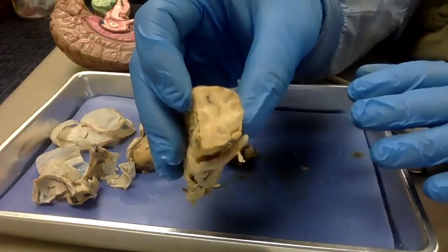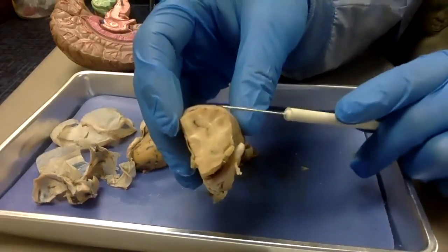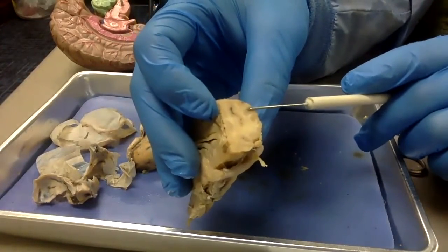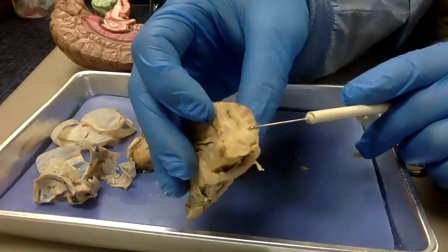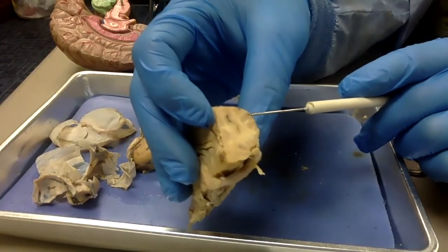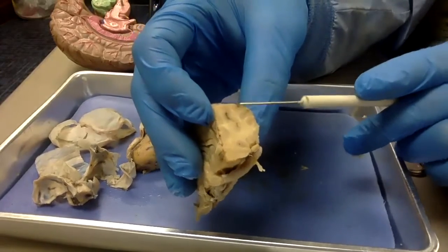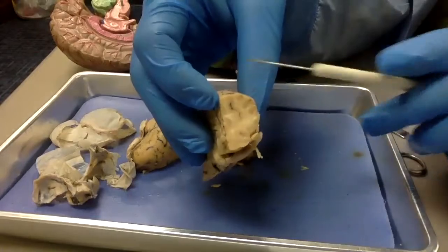Remember, your brain is made up of what we call gray matter and white matter. Now, this doesn't look very gray because of the preservative chemicals. It looks more like a tan now, but a natural brain is a bit grayer once you remove the blood. And then on the inside, it's a bit lighter. We call it the white matter. The gray matter is where all the synapses are, all the dendrites and the axon terminals, interacting with each other, sending information. So all of your thoughts are out here on the surface where all the gray matter is.